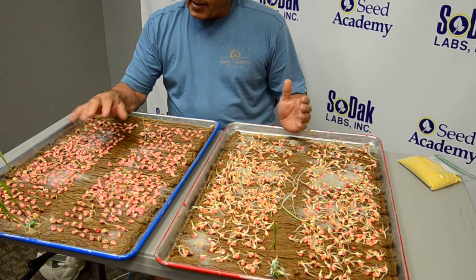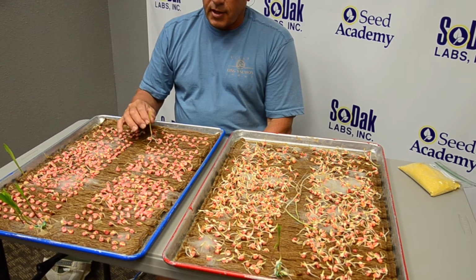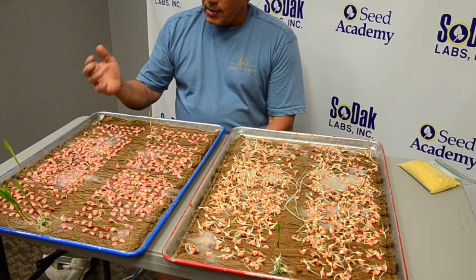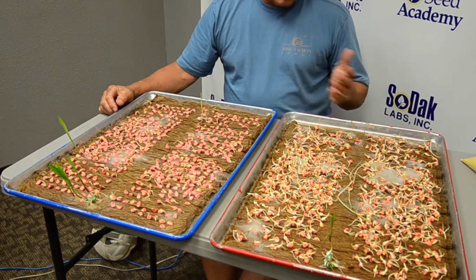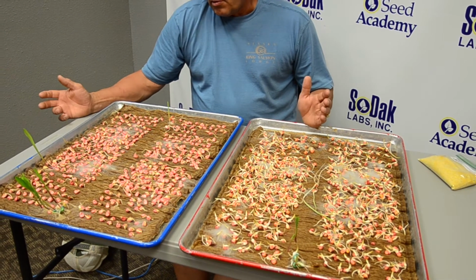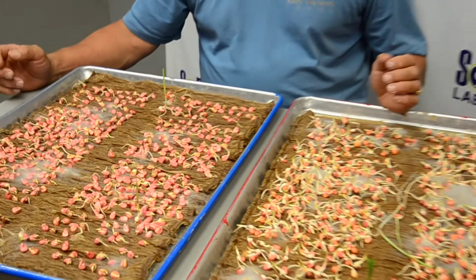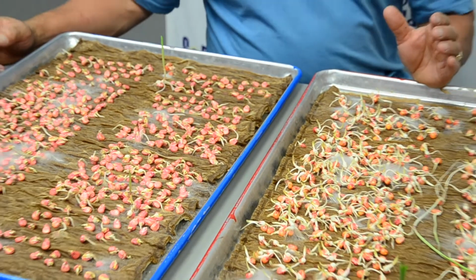But the reason I like doing these 2 bioassays is that this is very quantitative. You can see that there's 3 out of 1,200. So when you do 2 different herbicides and you get that similar rate of occurrence, you can be fairly certain there's a little bit of GMO in there, but not a large amount.